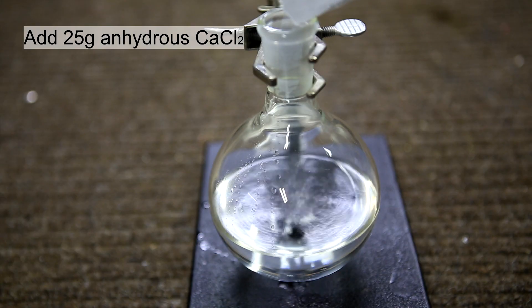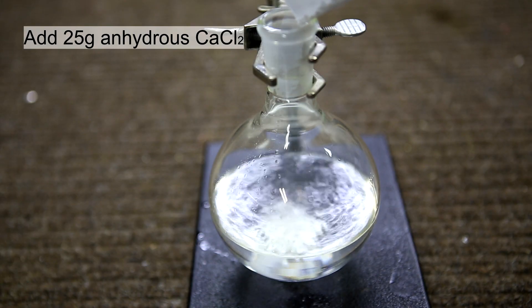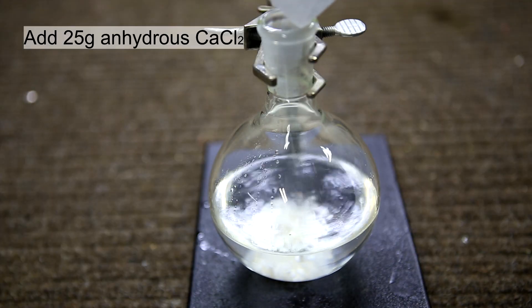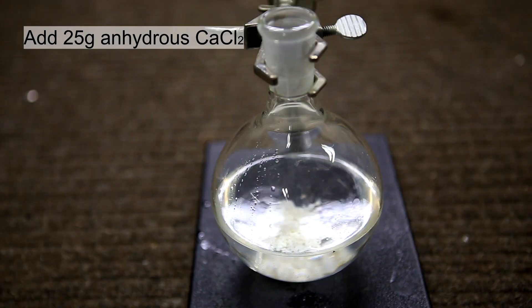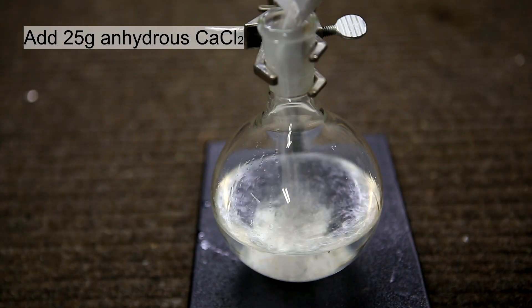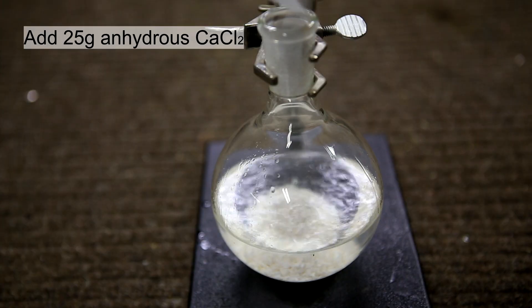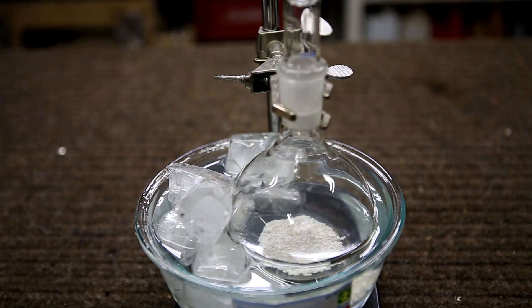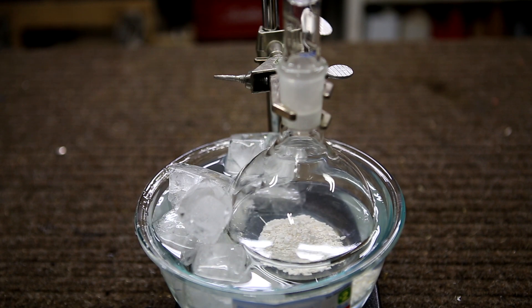To the ether is added 25 g of anhydrous calcium chloride. The calcium chloride is used to absorb both ethanol and water. It is recommended that you cool your ether on an ice bath before adding the calcium chloride, unlike I did, because the hydration of calcium chloride is exothermic. I let the ether sit with the calcium chloride for one hour in an ice bath.